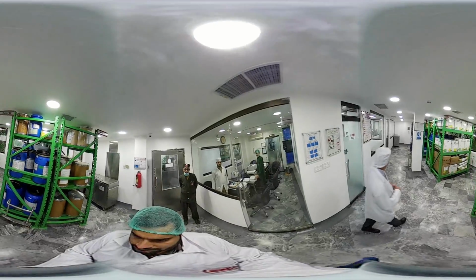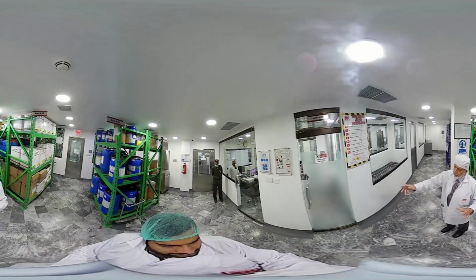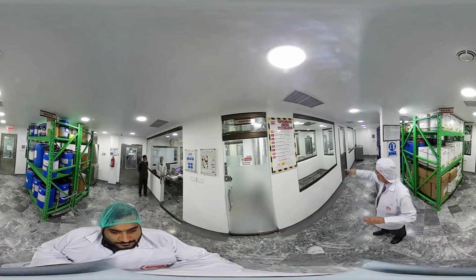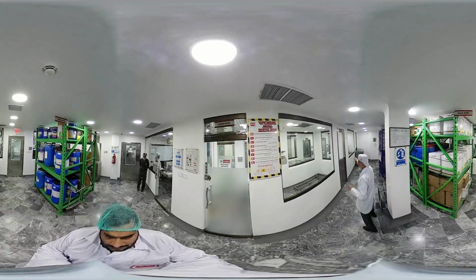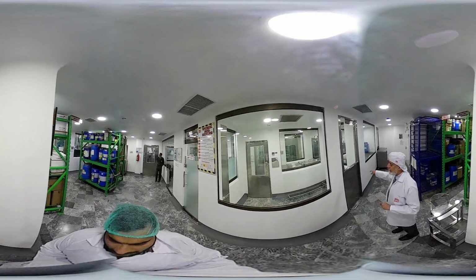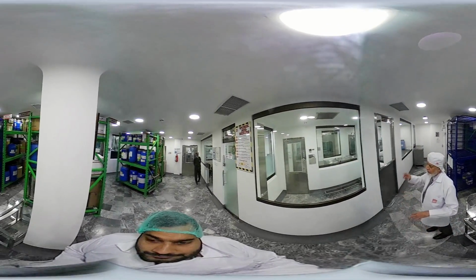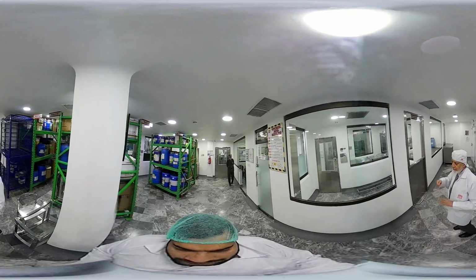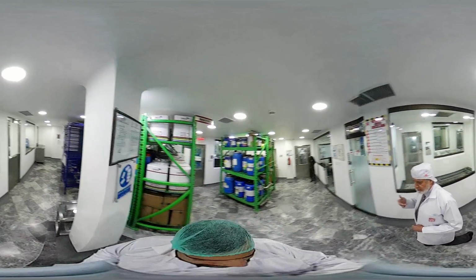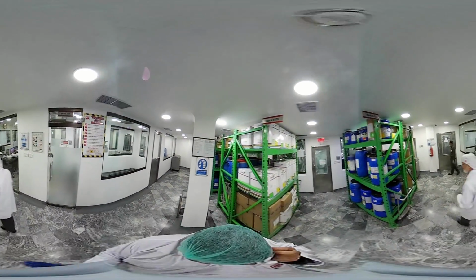Once all those containers are brought here as per requirement, we have 2 passages. One is a change room for the personnel who will enter the dispensing area, and the other is a segregated and separate passage for the materials through this trolley. Once everything is there, we go for the dispensing, and everything is dispensed as per formula and as per the requirement of the product.